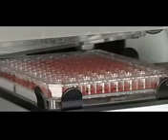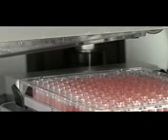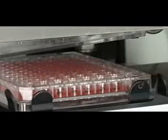Operating at lower flow rates and pressures, COPAS FP instruments produce less stress and potentially disruptive shear forces inherent in standard flow cytometers. Gentle handling means that objects remain intact and viable, with their morphology preserved for further experimentation.